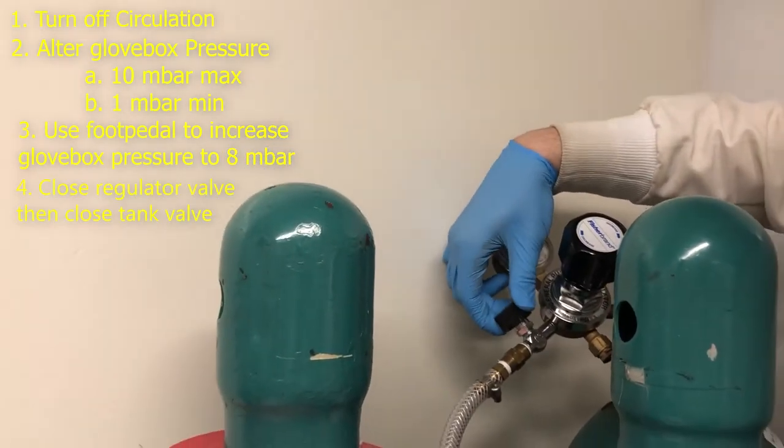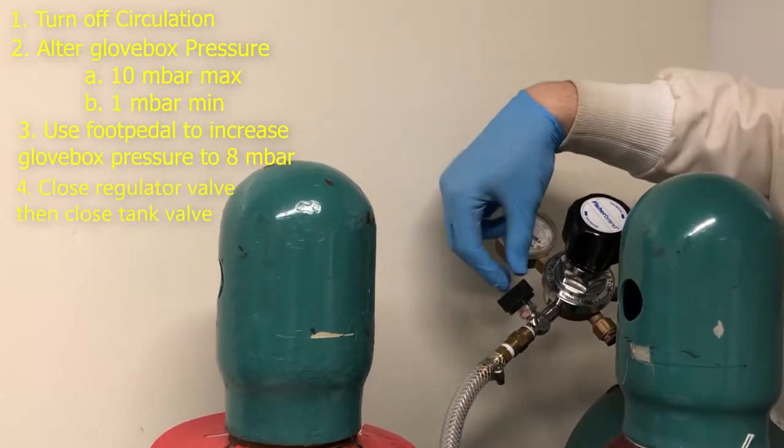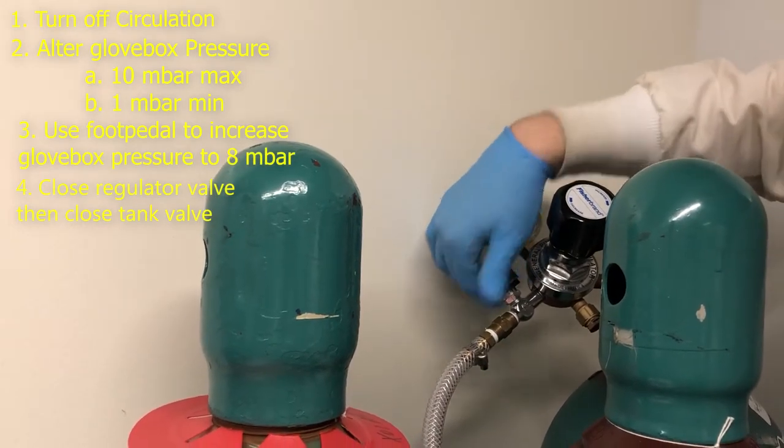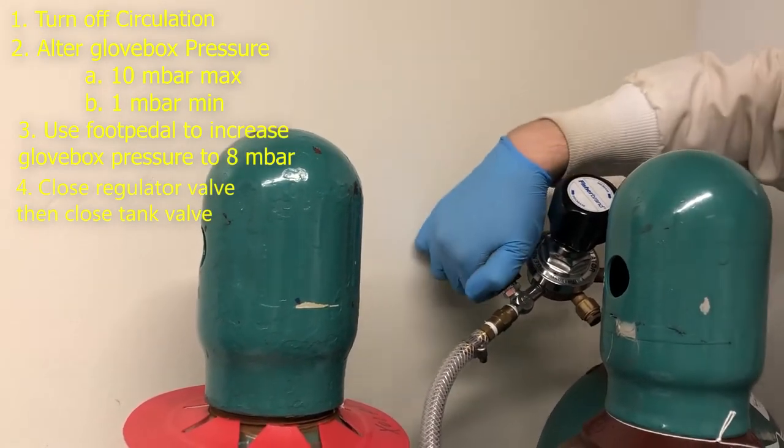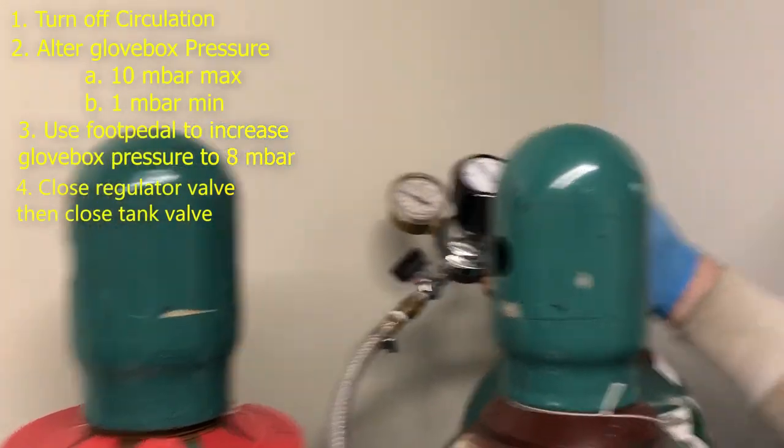Right? So what you're going to do is first you're going to close this valve. We never touch the actual regulator itself, we just touch the open valves. So we're going to close this valve all the way. Okay. Nice and tight. And then you're going to close your tank nice and tight all the way.